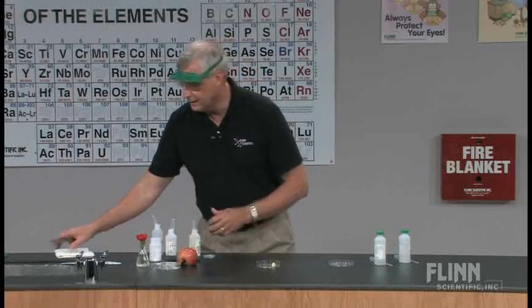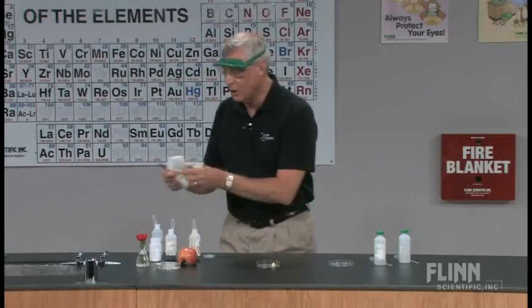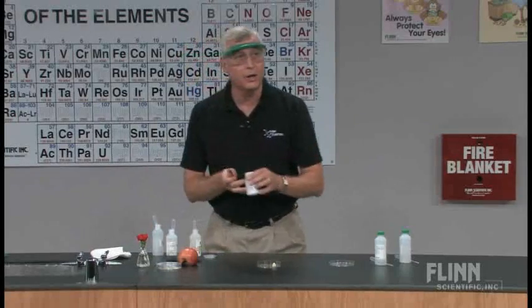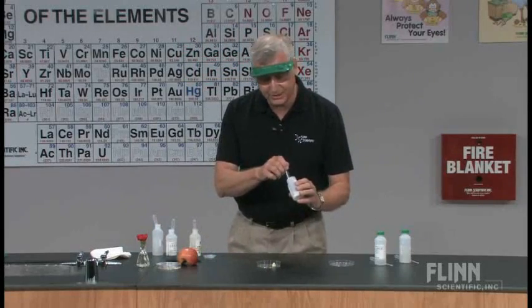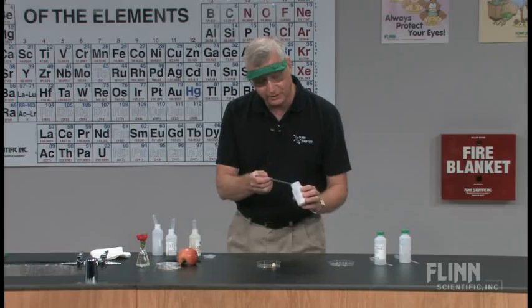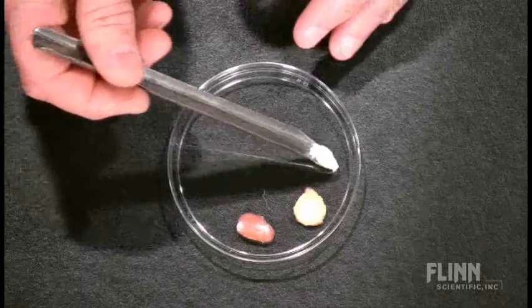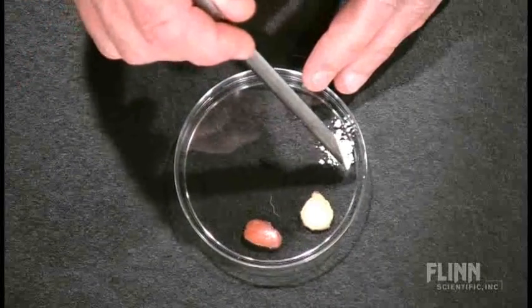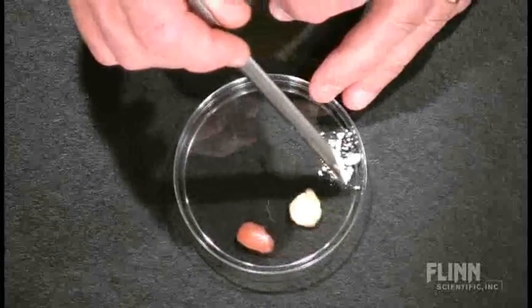In addition, we'll take and put a small amount of calcium carbonate. There are a lot of limestone type materials, and calcium carbonate will simulate some building materials and some environmental kinds of conditions that we might have. So we'll place a small amount of calcium carbonate in there as well.